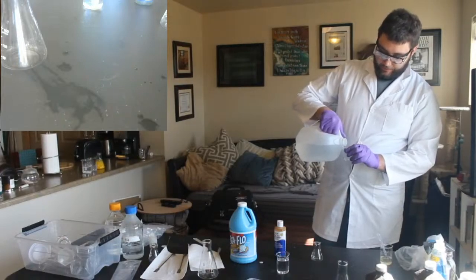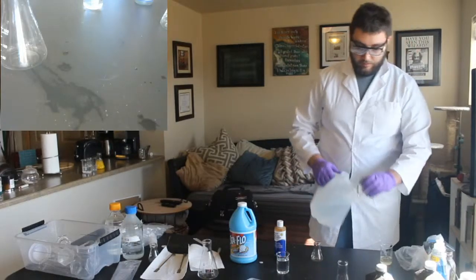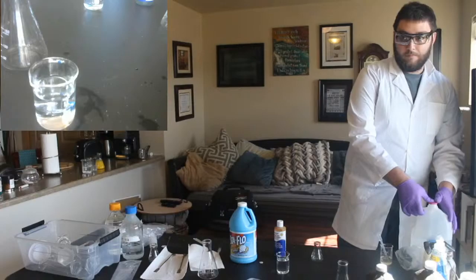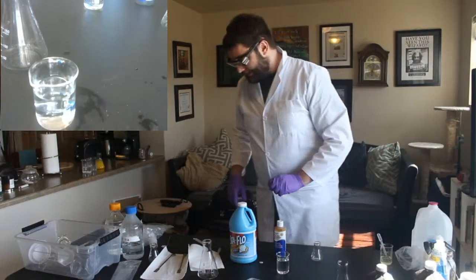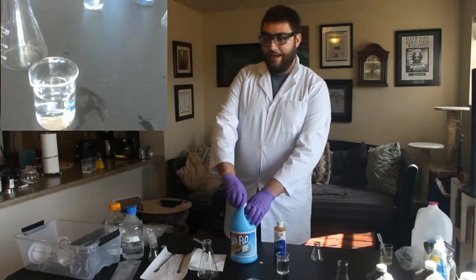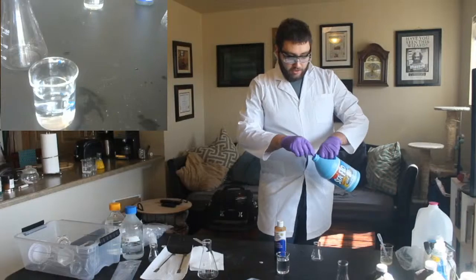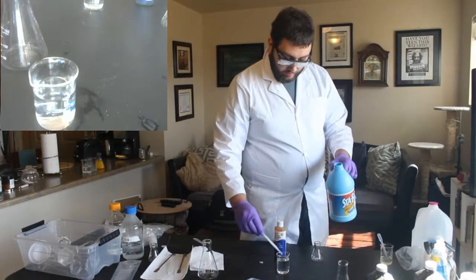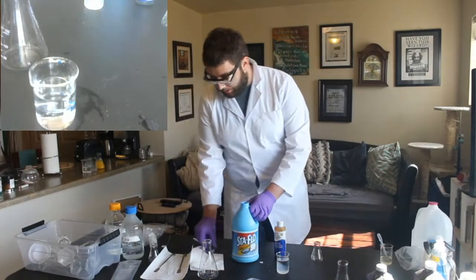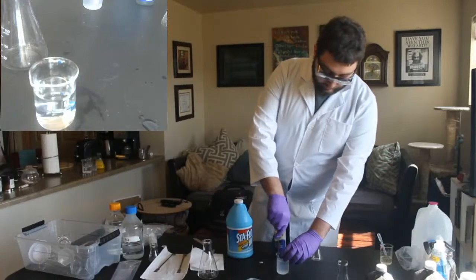Besides just water. It's the thing we were missing last time. Iodine, good. Yep. So the hydrogen peroxide one gets starch, and remember, we don't need a lot, because we found out last time that was not our limiting thing.